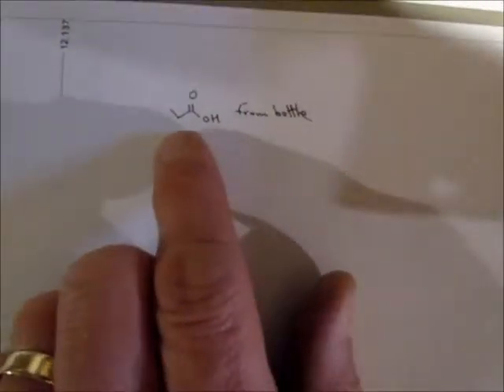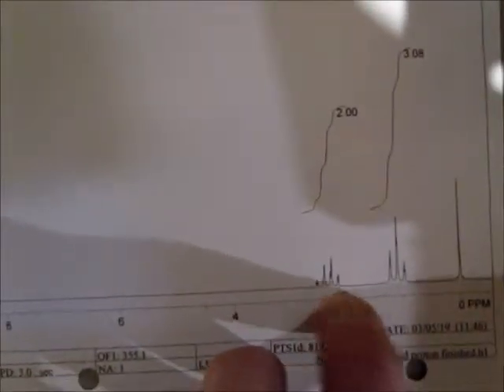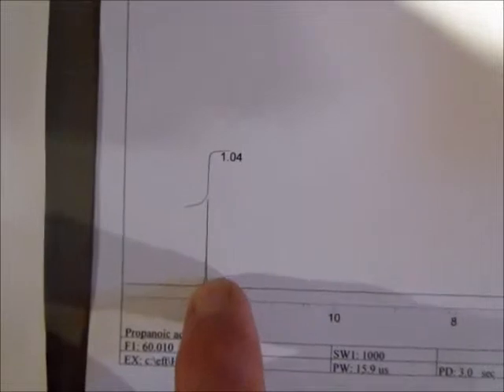The newer one you guys are using this year, it's going to look a little different only because you got that ethyl group, which means you expect to see a quartet and a triplet. So you get a quartet, you get a triplet, that's the TMS, and then the OH absorption for NMRs there.